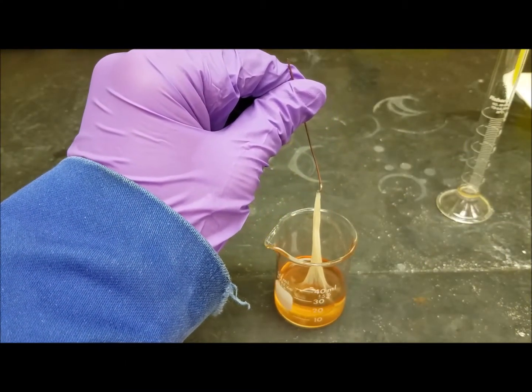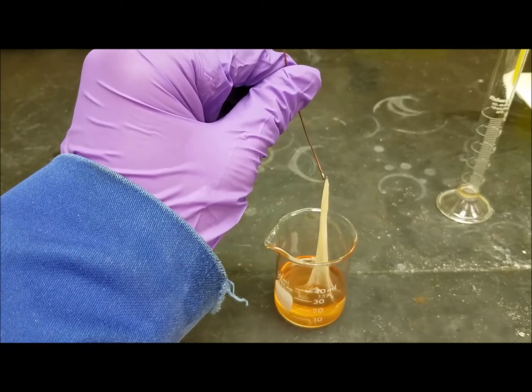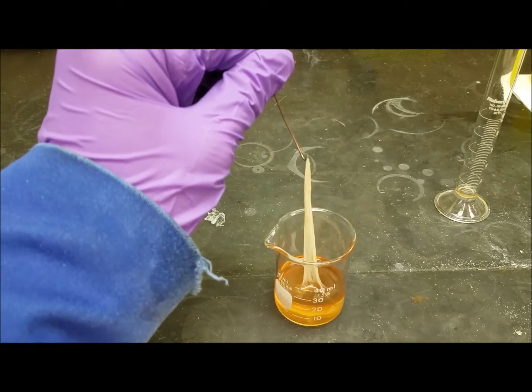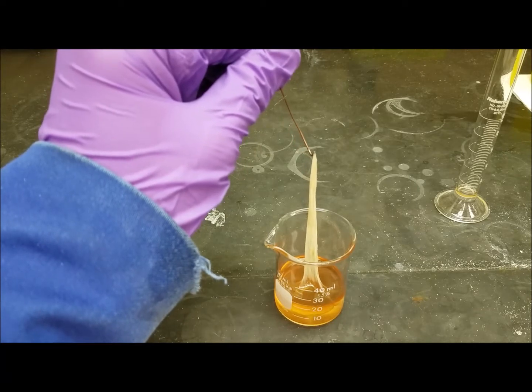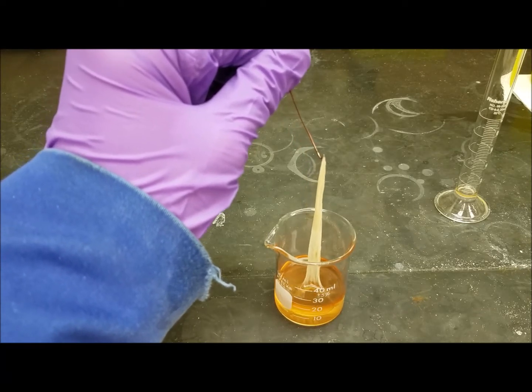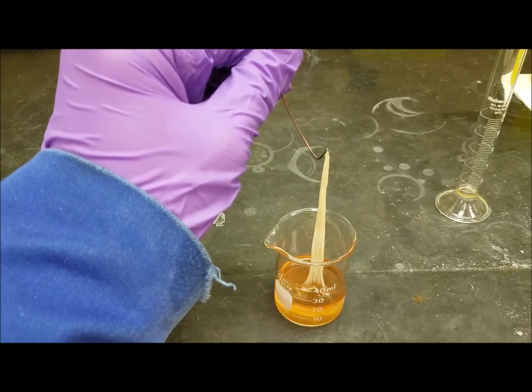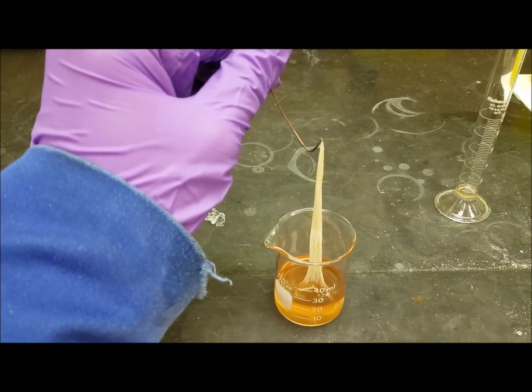Notice as I pull this off, it keeps on coming. Right. And this is because the reaction continues happening at the interface. As I remove material from the interface, more of the polymer is able to form.